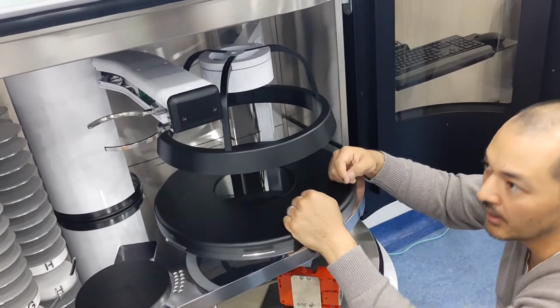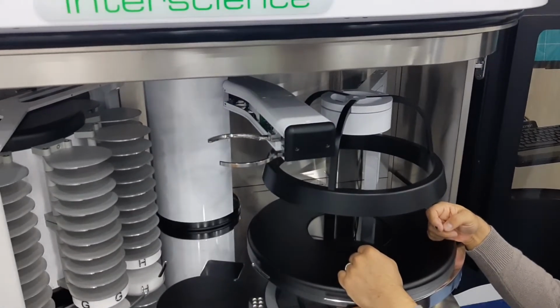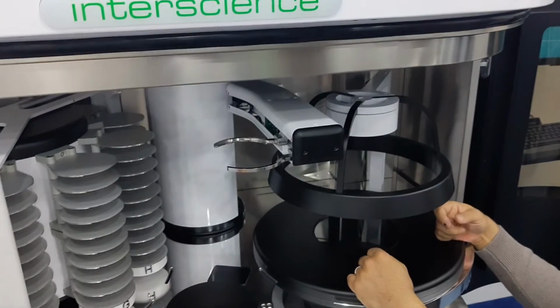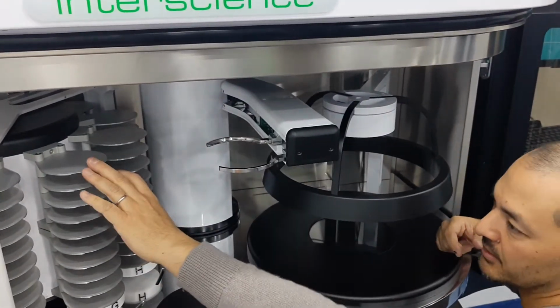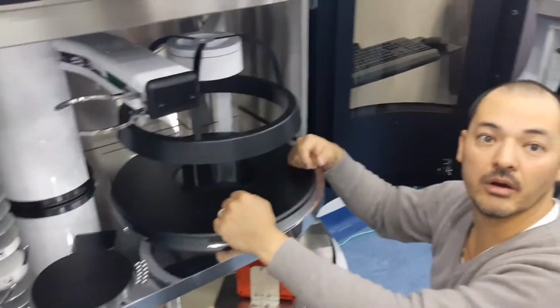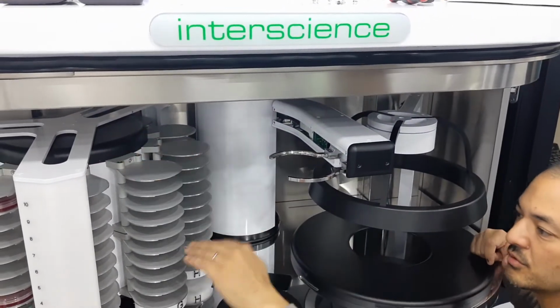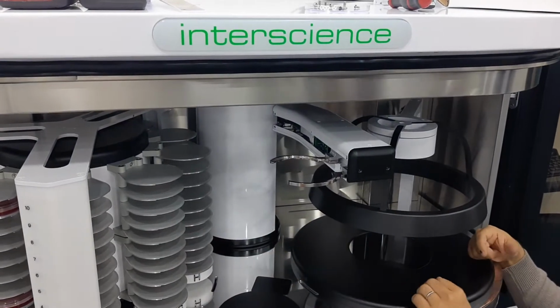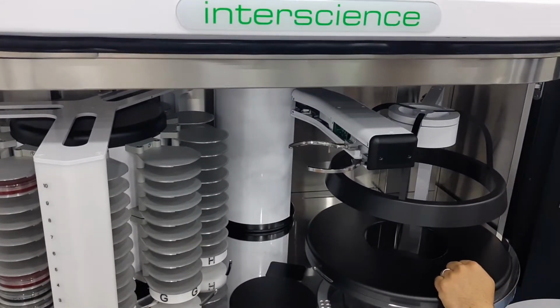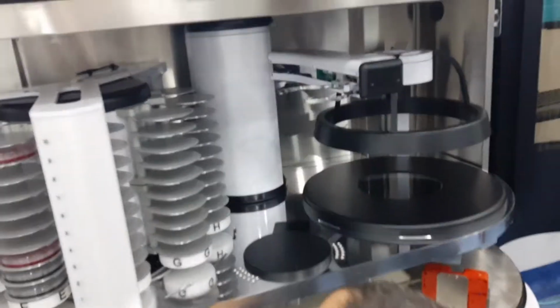So the way to change it is that you take the 3 screws off, and then there's 4 screws. It's quite easy. So there's a little hatch there to be able to change them. Also, if those are bent, the vertical position also needs to be a bit accurate, maybe plus or minus, I don't know, 1 millimeter. And also those blocks you can change 5 by 5. There's 2 screws there to be able to change the block and replace it. So that's about it. There's a little dust. Maybe we can clean it while we're there.